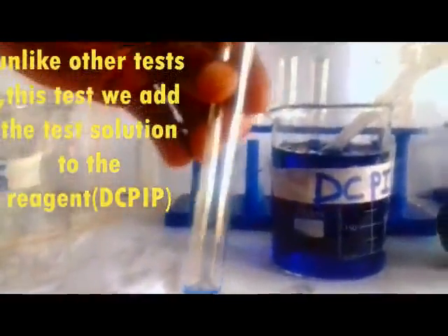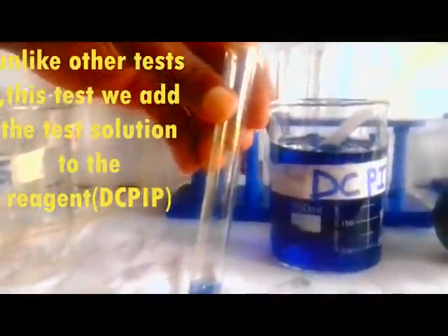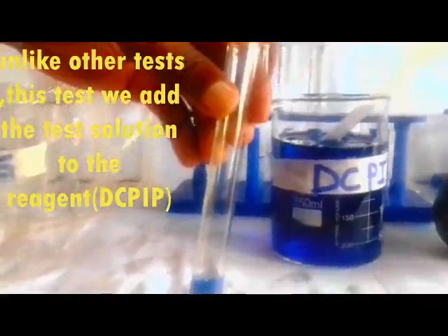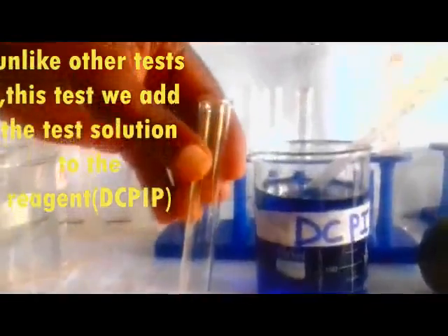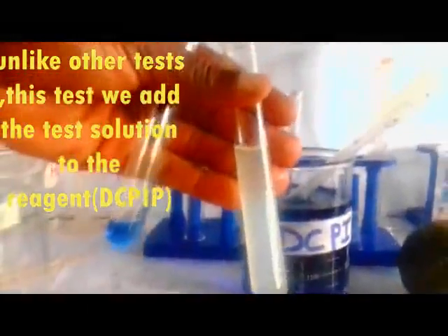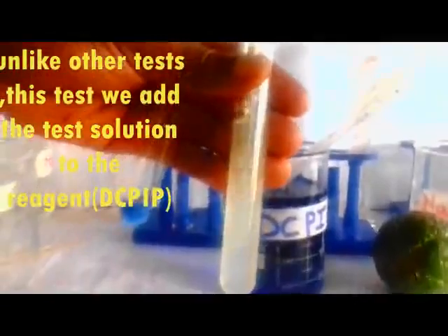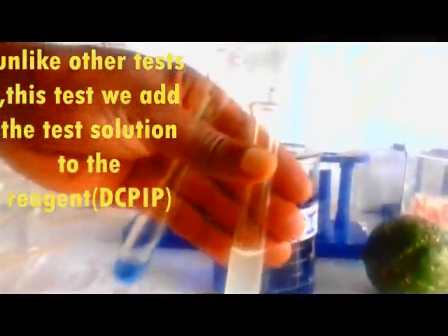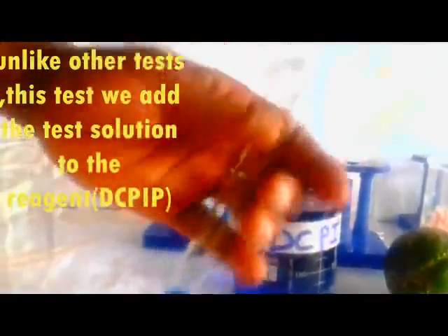Now what am I going to do? I'm going to transfer some drops of the food now. So there I get my food. This is the food or the juice which you have got from the lemon. So I get my dropper. Then I get some juice from my test solution.